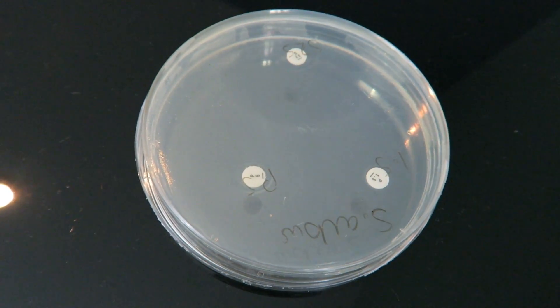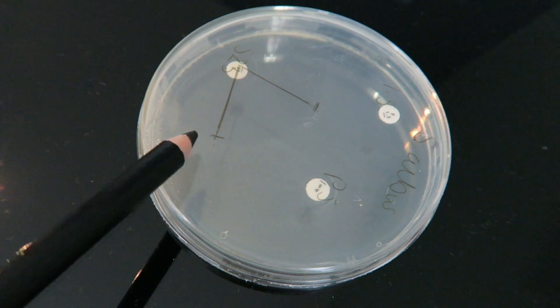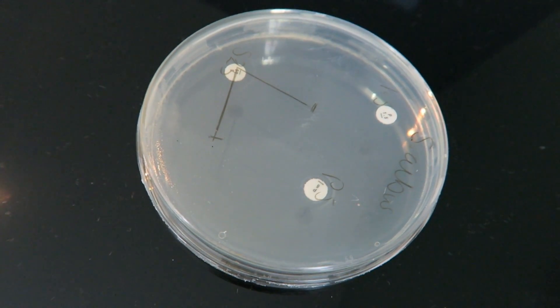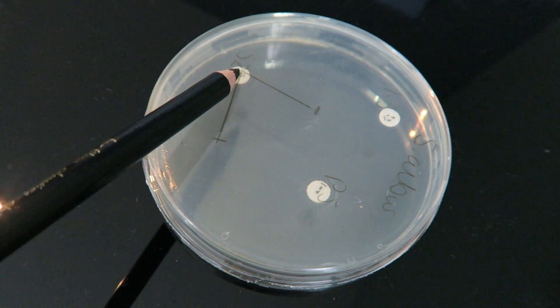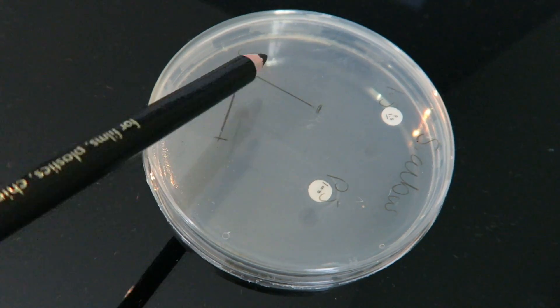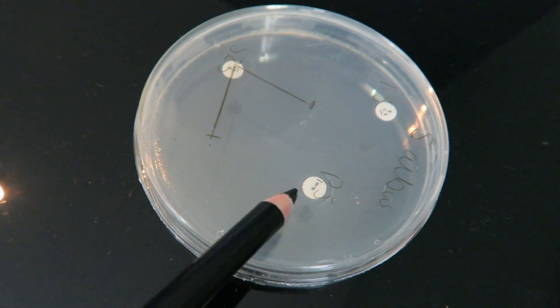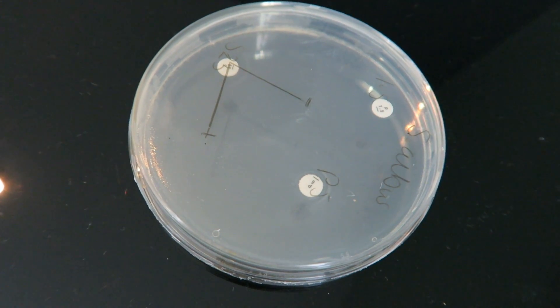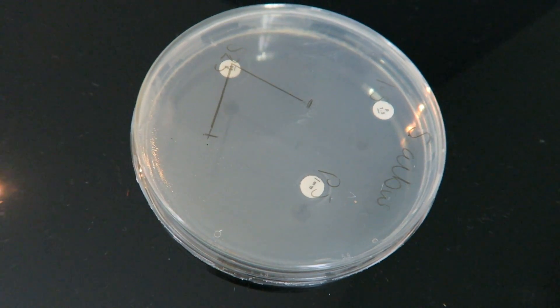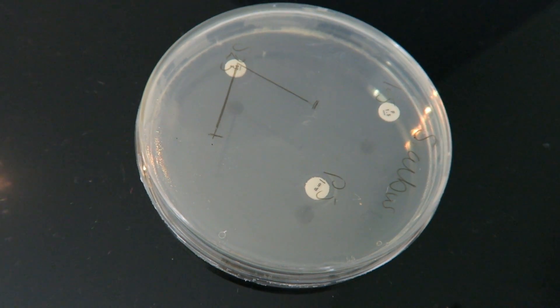Now we're gonna measure that clear zone. I'm measuring the radius — it is best if you measure the diameter, but you'll notice this has such a large clear zone it would go off the plate. Measuring in two different locations in case your clear zone is asymmetrical, going from the center to the edge. We have a clear zone radius of 2.5 centimeters. The clear zone around the penicillin discs is very, very small, but for the streptomycin we've got a nice big show of antibiotic sensitivity.